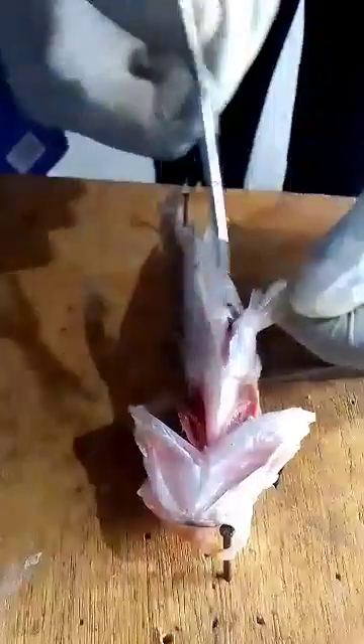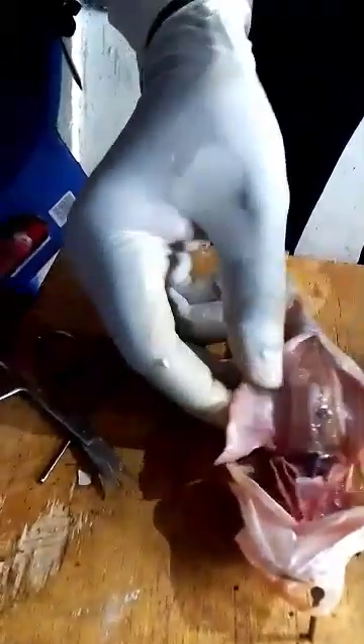Be careful not to cut underneath the tissue. Now, the fish does not take time — when you open it like this, if you are provided with nails, you just nail it here and on the other side.